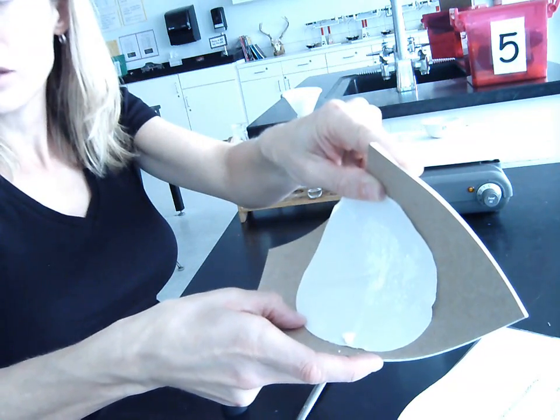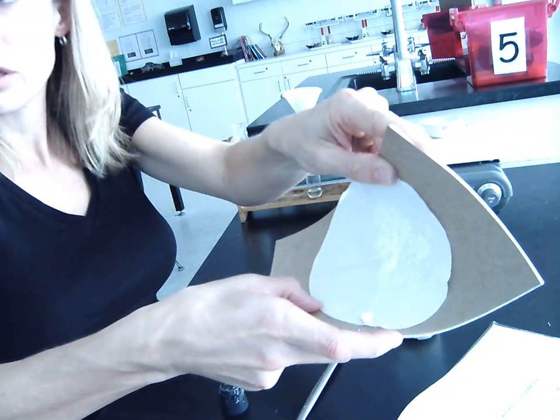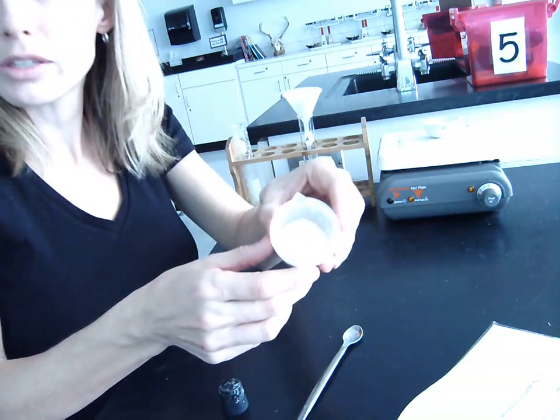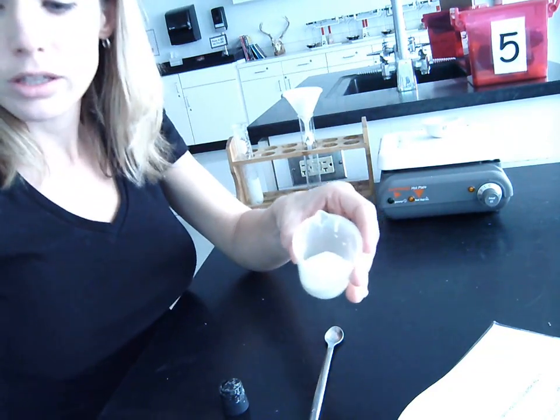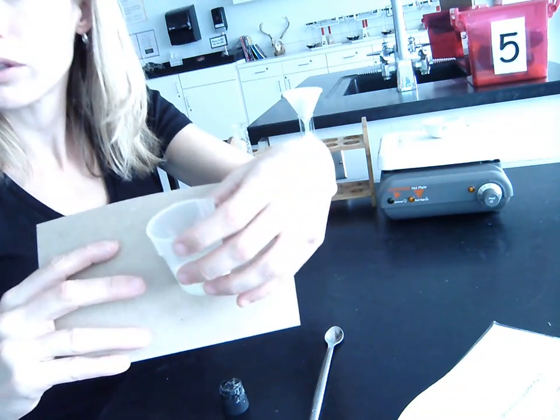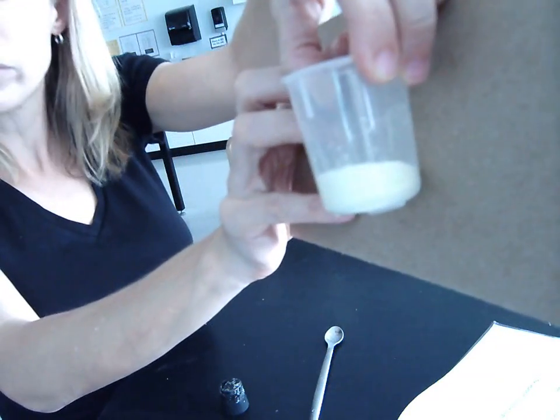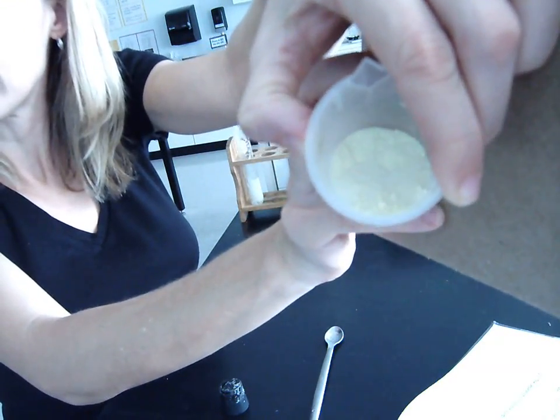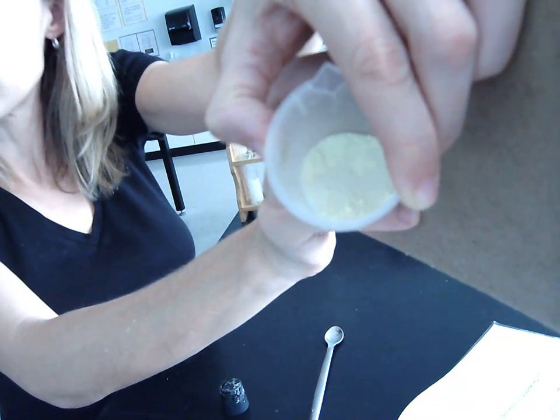Once you let it dry and all the water dries out, you're left with the sulfur. So if you think back to what we started with, this mixture, again, which is very hard to see because of the glare. I don't know if you can see it if I put this behind it a little bit. Let me turn it this way, away from the sun. Okay, that works pretty good. You can see it better now. That's the salt and sulfur mixture. That's what we started with.